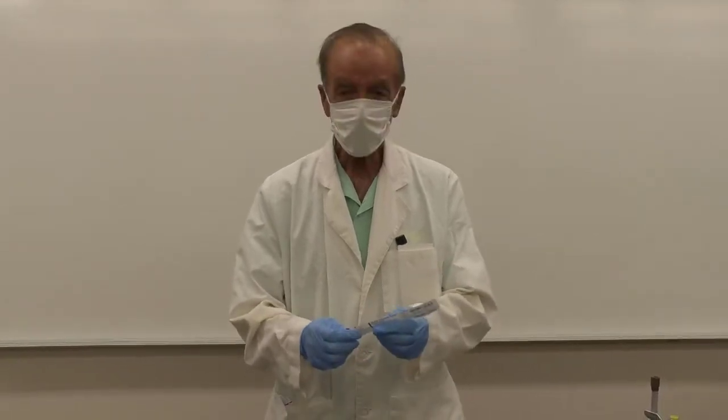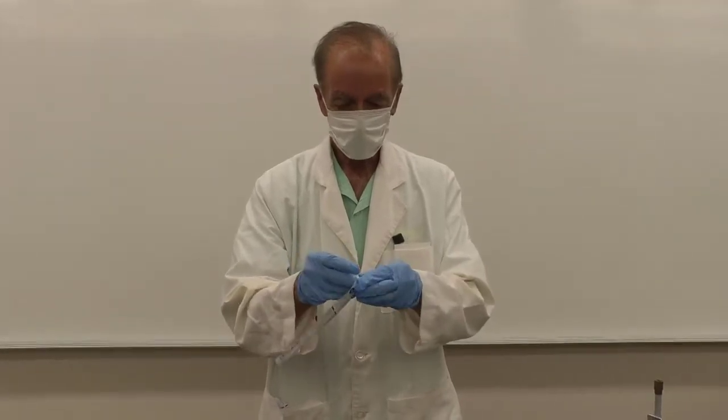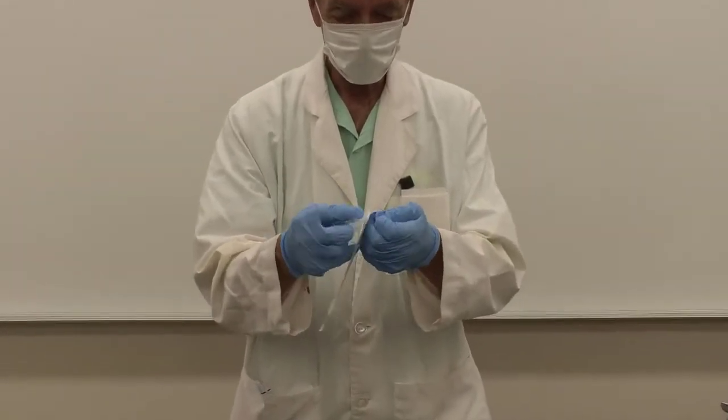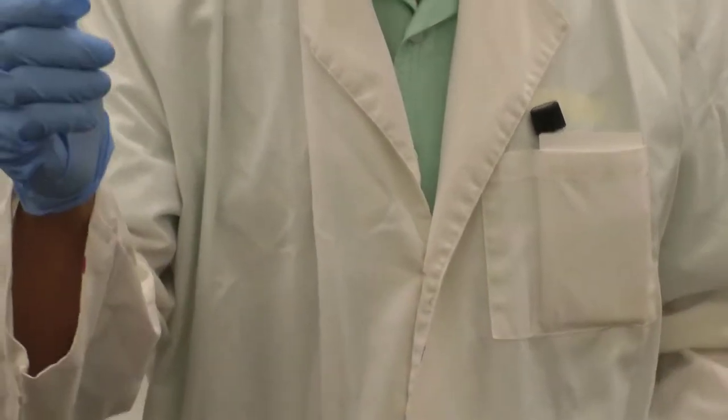So we need to swab a surface, so I need a sterile swab. Sterile swab is open at one end. Don't want to touch it to any surface, keep it sterile.